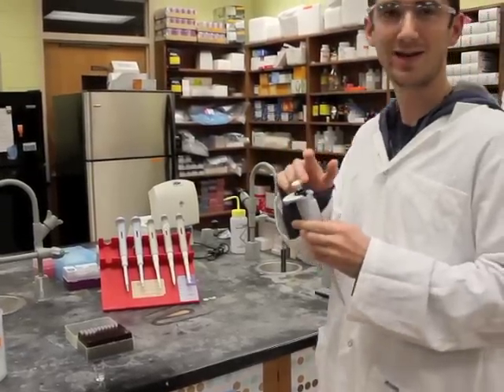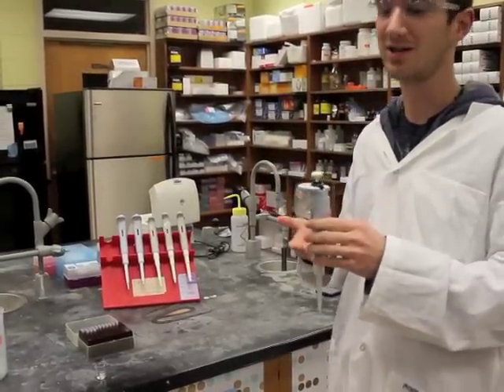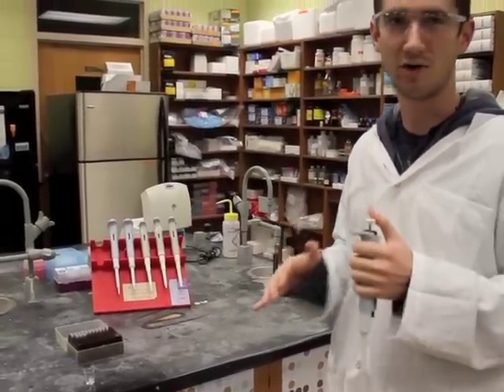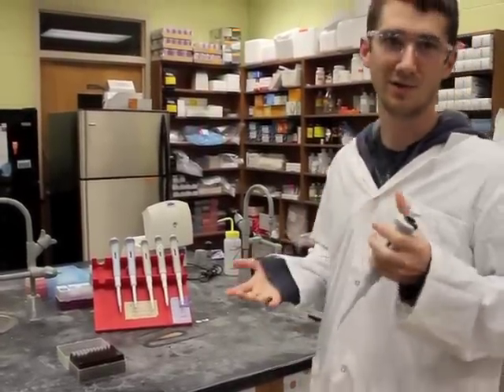So now that we've got our white-capped 10 microliter pipette, which is also called the P10, we'll be using this for the rest of the lab to measure out all of our reagents. First of all, we have to learn how to use it.